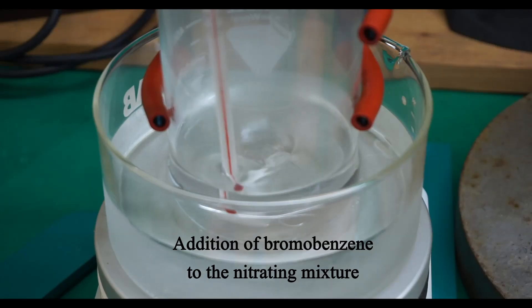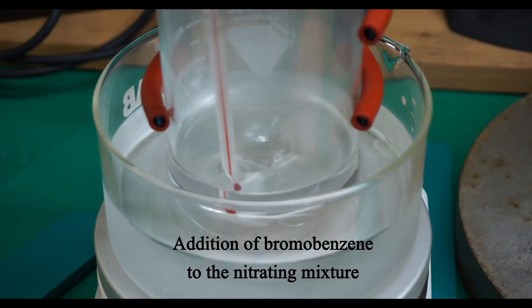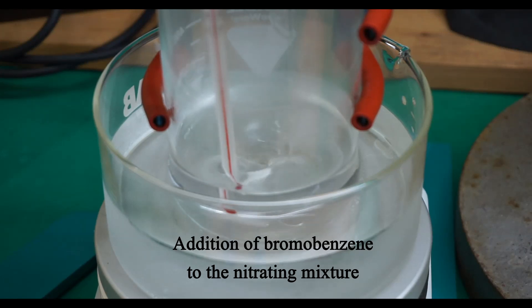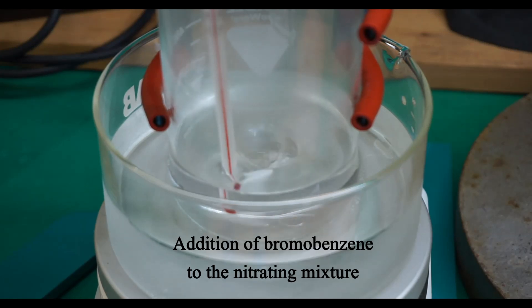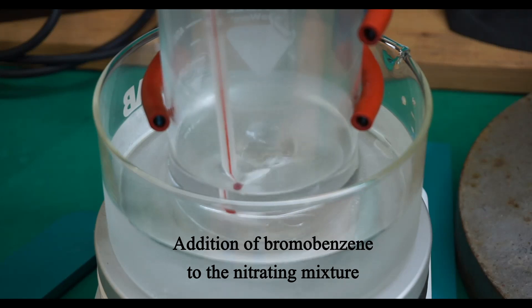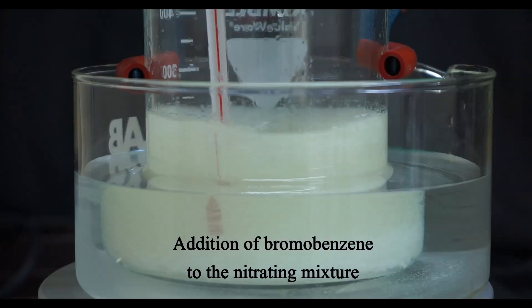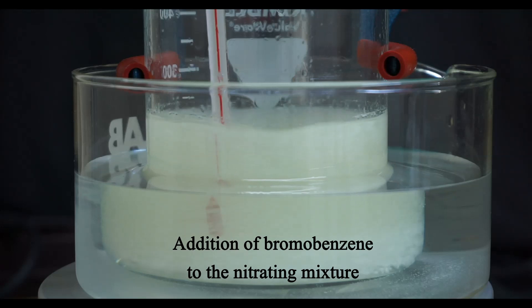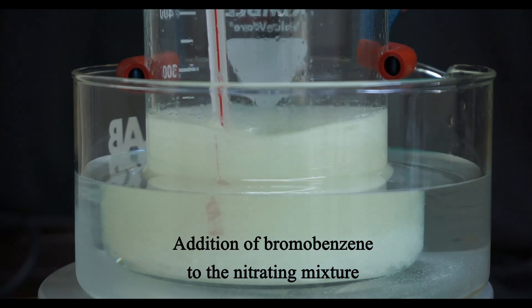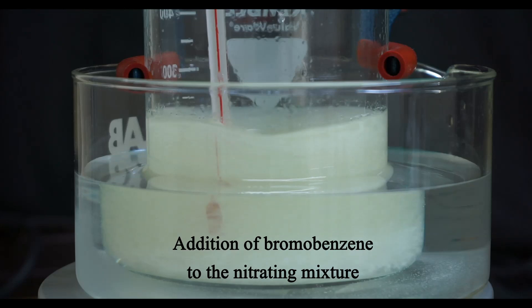I was careful not to add the bromobenzene too quickly because the nitration reaction is exothermic. During the entire addition of the bromobenzene, the temperature of the reaction mixture didn't exceed 40 degrees Celsius. At the beginning everything was okay, and the drops of bromobenzene dispersed and, as the reaction proceeded, solidified.